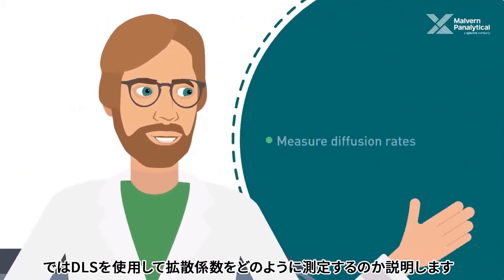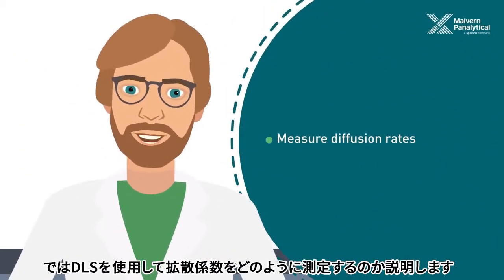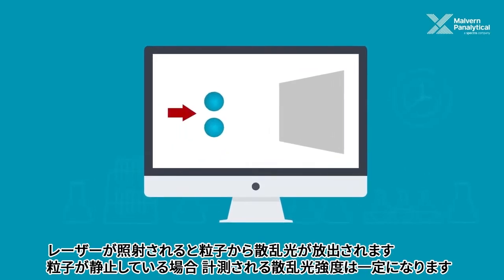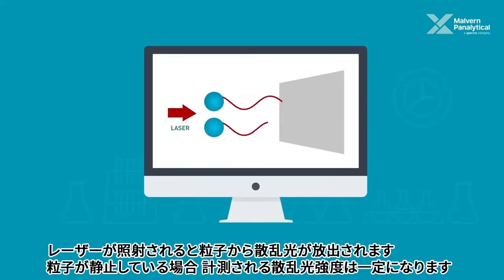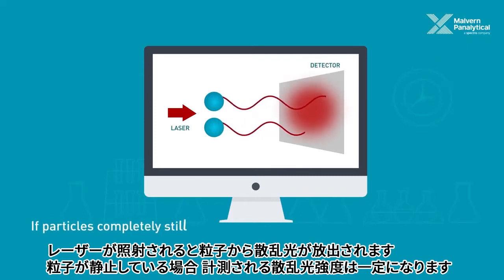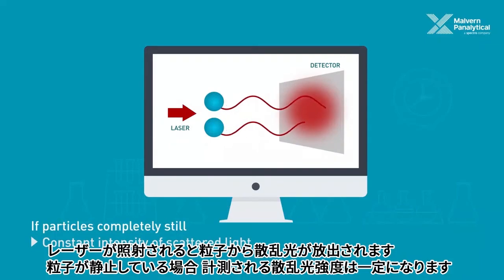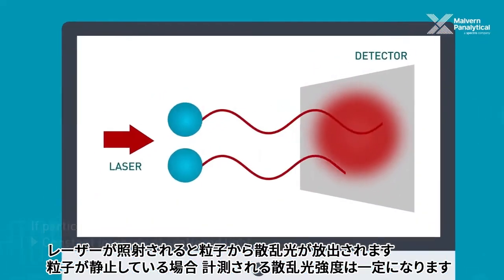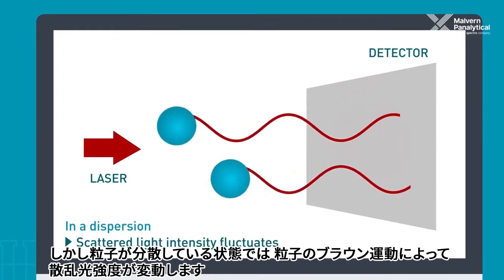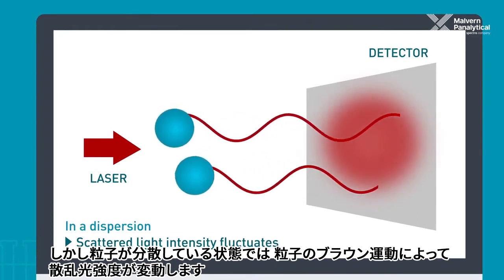So how do we measure diffusion rates using DLS? Imagine we illuminate particles with a laser — they'll scatter some of the light that hits them. If these particles were completely still, we'd measure a constant intensity of scattered light. However, in a dispersion, diffusion causes the intensity of light scattered by the particles to fluctuate over time.